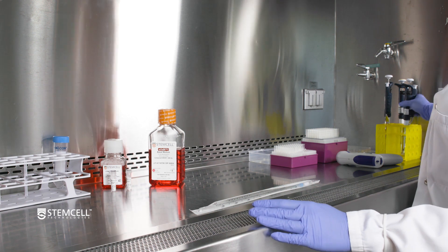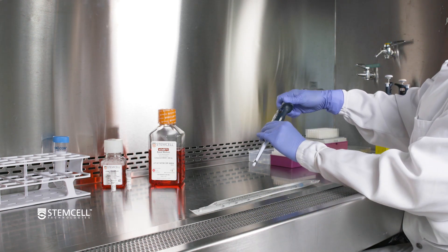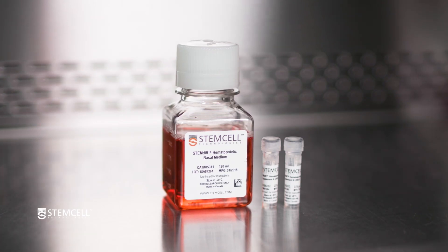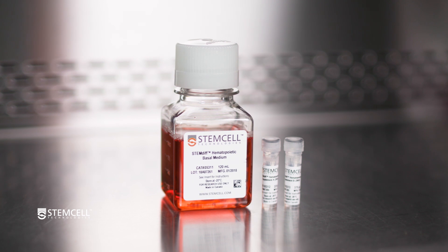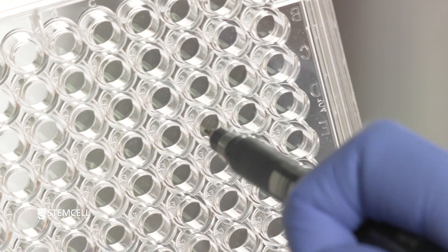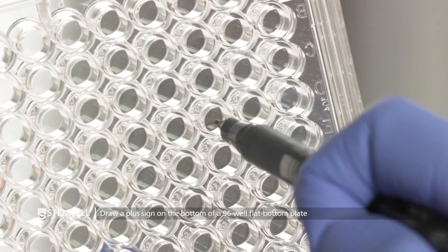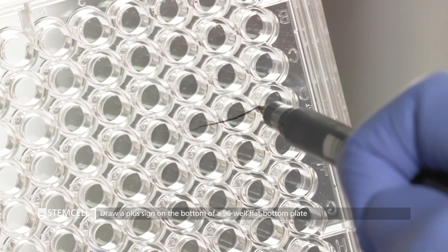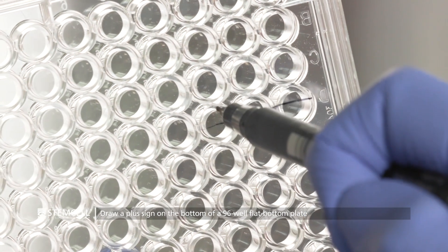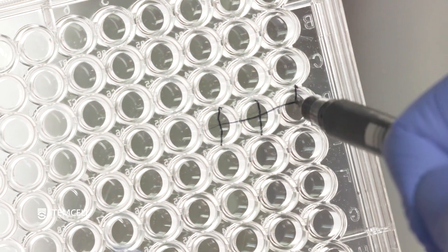We will show you how to count human pluripotent stem cell aggregates to determine and adjust plating densities for maintenance and differentiation. Draw a plus sign centered on the bottom of three wells of a 96-well flat bottom plate to serve as a counting grid.